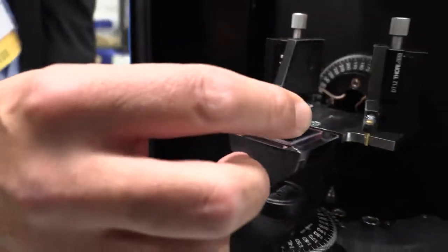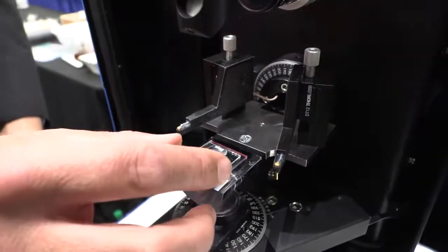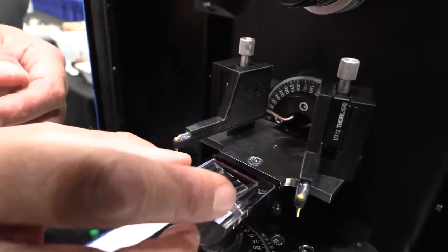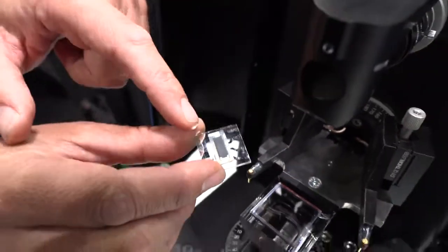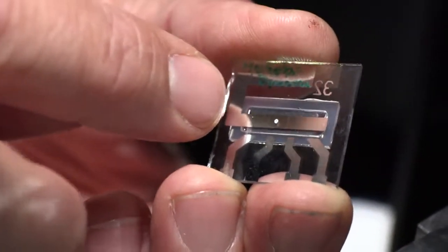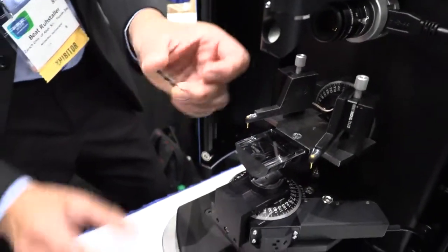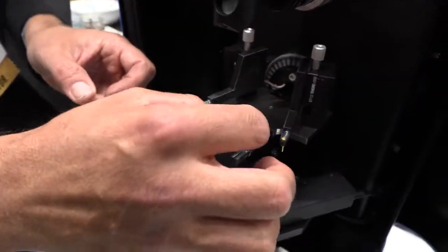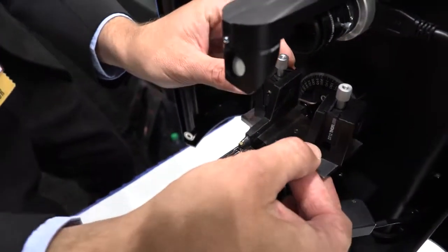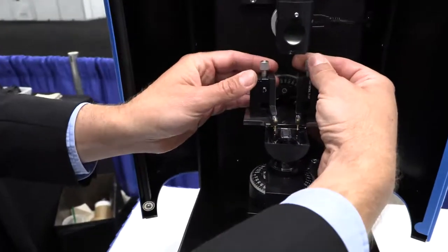And instead of this film, I could also place the OLED here and directly excite the OLED. Instead of doing an optical excitation, I can also do electrical excitation called electroluminescence. Which part is the OLED? It's not so easy to see because there is an encapsulation glass and a metallic cover. Usually if I have an electrical contact, then the light would come out from this side. But I would have to remove this sample and then place the OLED here, and then make sure to contact the electrical pads. But now, I would still need to change the vertical position here in order to touch these pads.